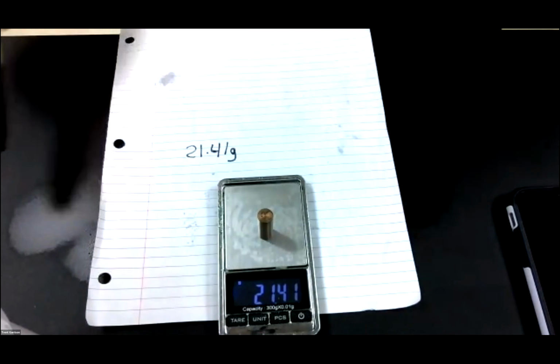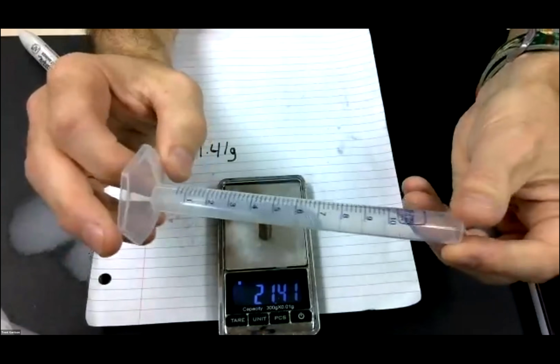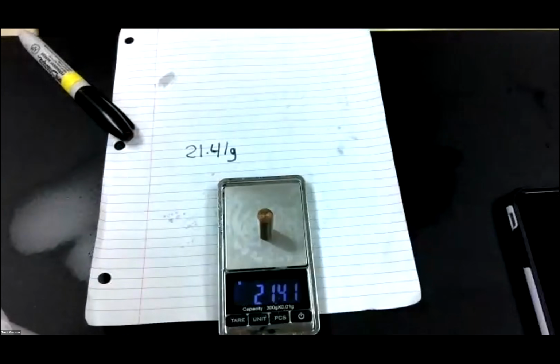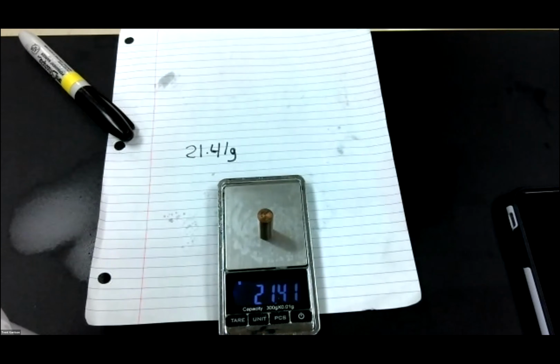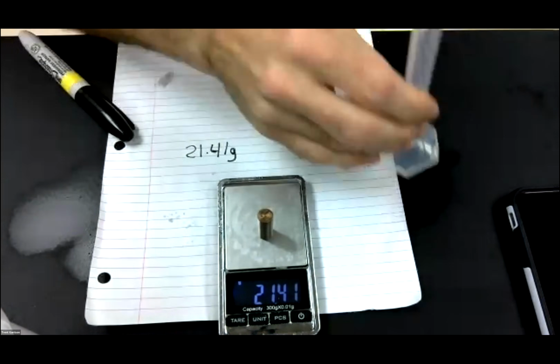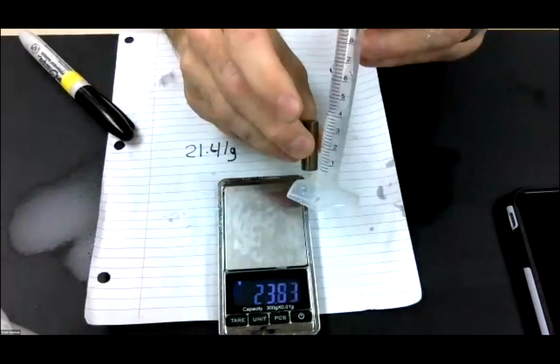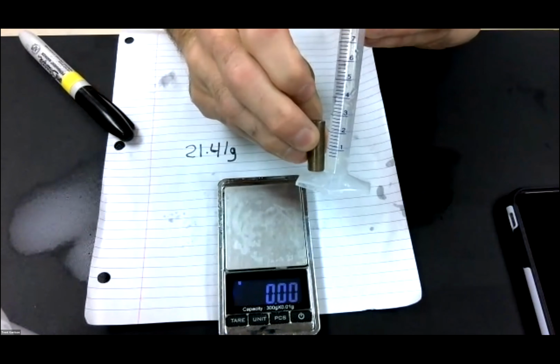And then let's get the volume. So what we have to do to get the volume is water displacement. We're going to use a graduated cylinder. I'm going to put probably just a few milliliters in here. Let's see, I'm going to estimate it, just a guess of how much I'm going to need. I just need enough water in here to cover up the metal. So it looks like the height of my water is taller than the height of the metal. So I think we're going to be okay.